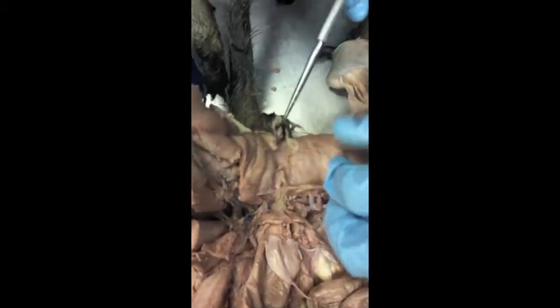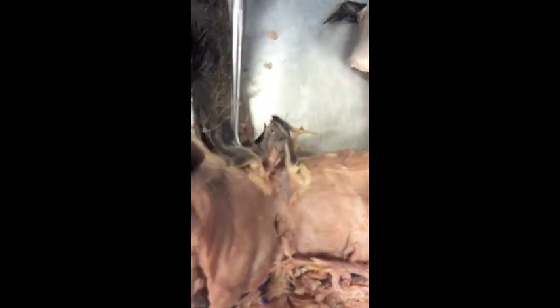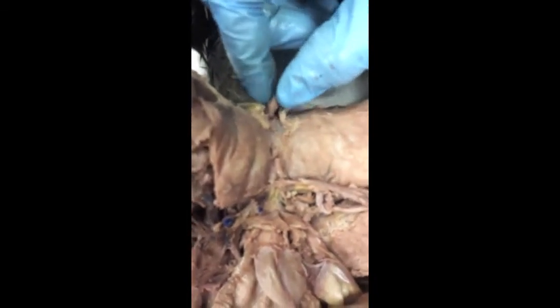The little kitty penis, now his penis got a little bit cut, oops, so it's a little shorter than it should be. It's missing its pointy little tip. But that's what's left of this poor little kitty's penis. And if you feel the penis, you can feel the little barbs on there. It has a little spininess to it.